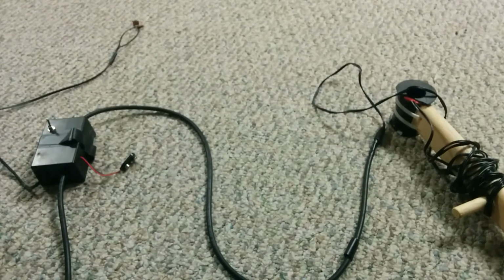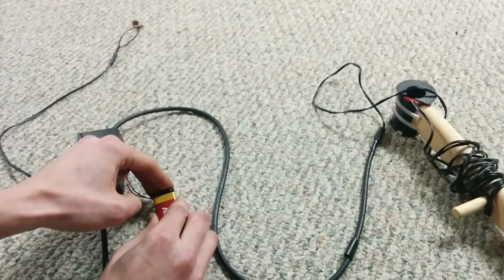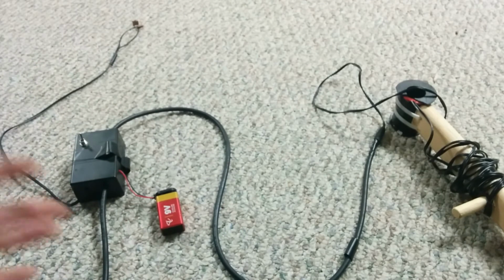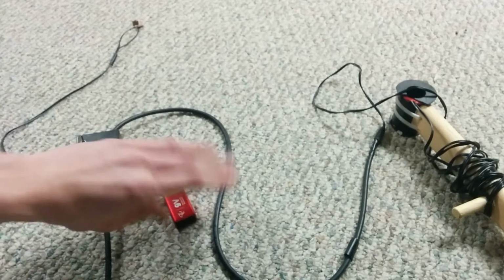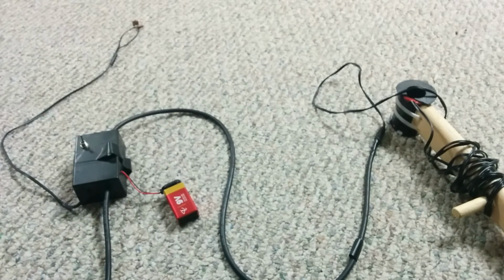Oh yeah, so to test this thing out, let's power this amp up since I haven't. Oh, look at that. See? It's oscillating. Oh, well, it was just when I touched the battery. I guess that's when I powered it up. I don't know. Anyways.